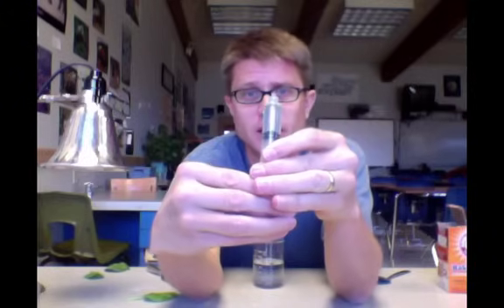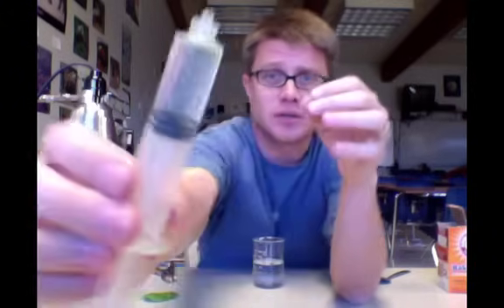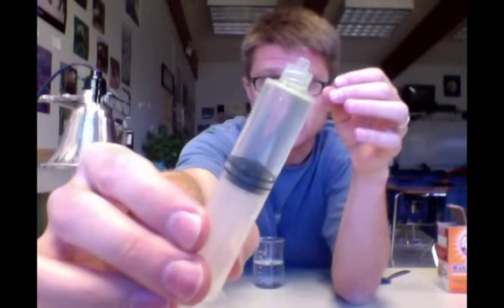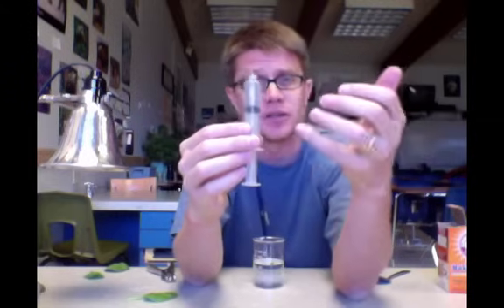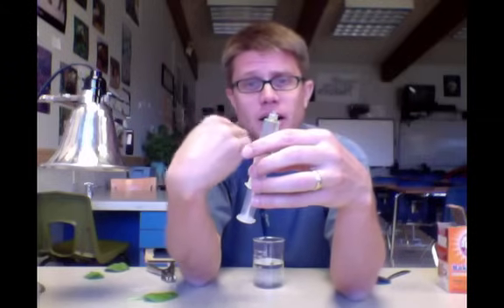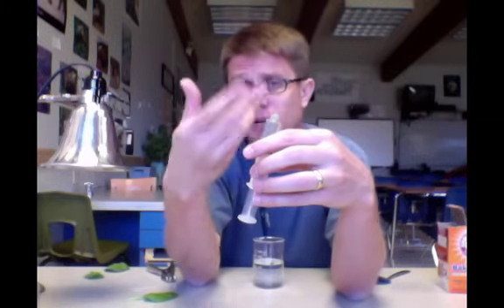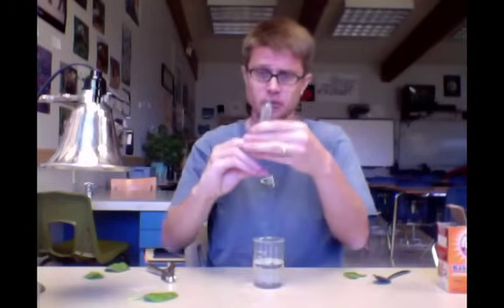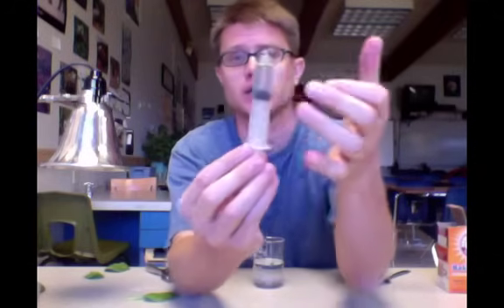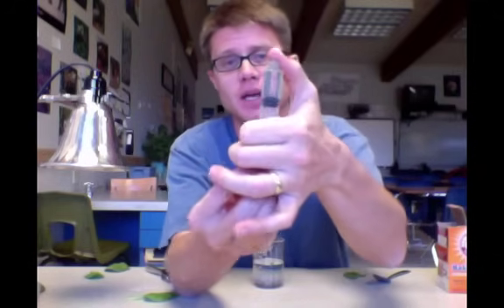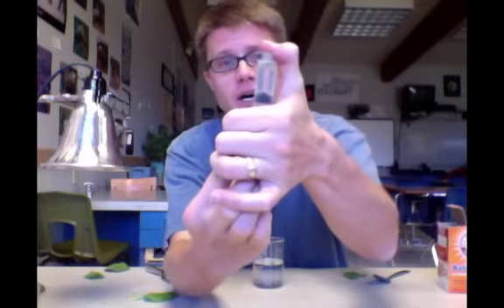In here the leaves are still floating. You can see that they're at the top of the syringe. Our goal is to get them to sink. What we have to do is pull all of that air out of the leaves and then replace it with water. I'm going to get rid of a little water. To do that we create a vacuum. What I'm going to do is hold my thumb over the top and then pull on the bottom.